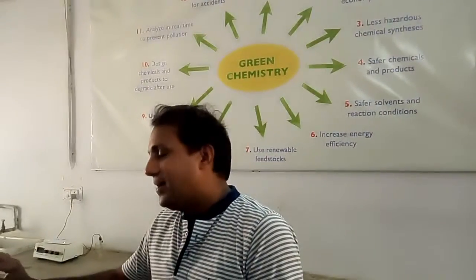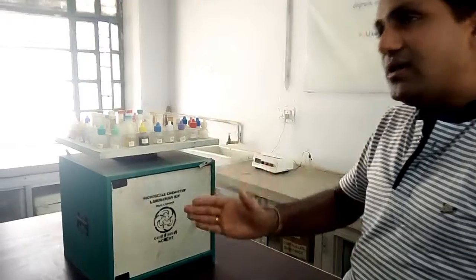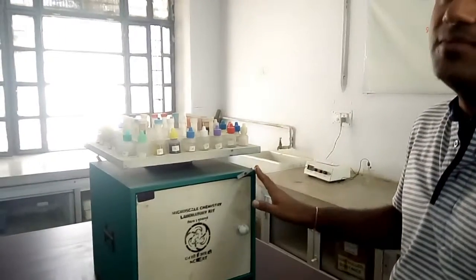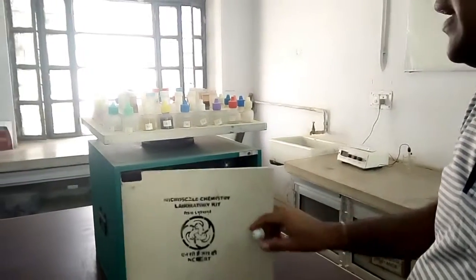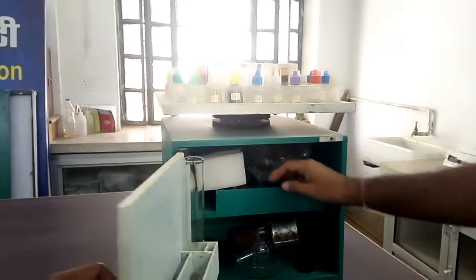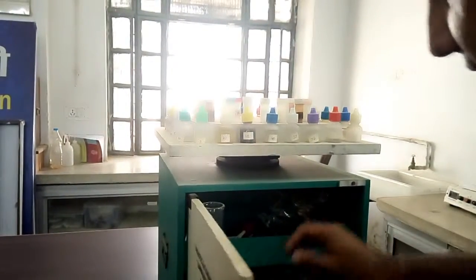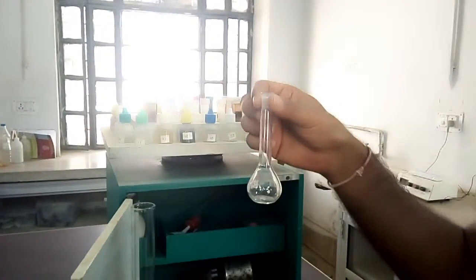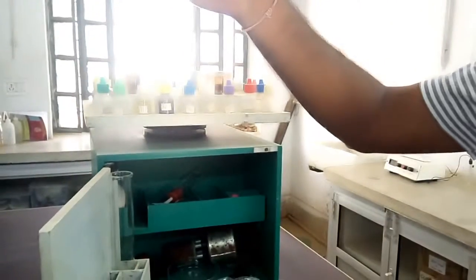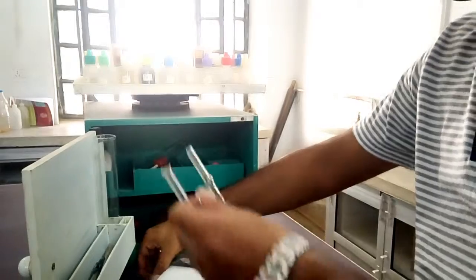This is a lab in itself for senior secondary level, meaning you don't need a separate lab for performing experiments. All experiments from primary level to 12th standard can be performed here, and we even apply these experiments at the undergraduate level. This is known as microscale because everything is used at the micro level — for example, this round bottom flask. In normal chemistry you prepare 100 ml solutions, but here you prepare solutions of 25 ml or 10 ml using this small volumetric flask.